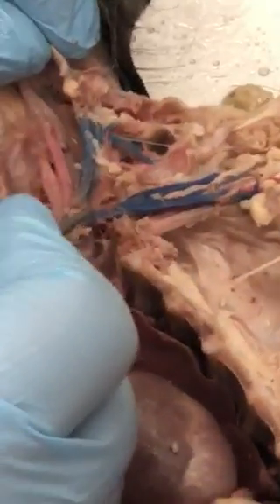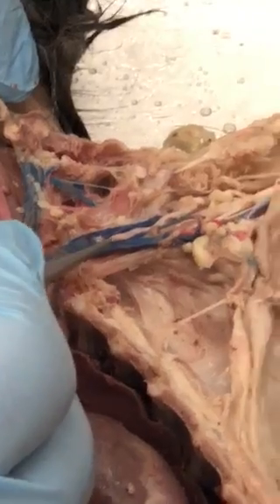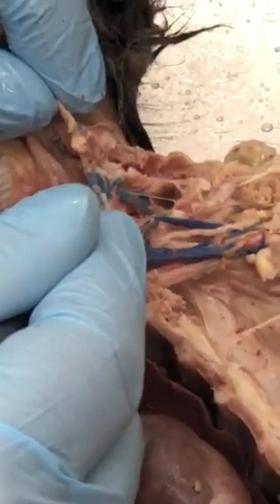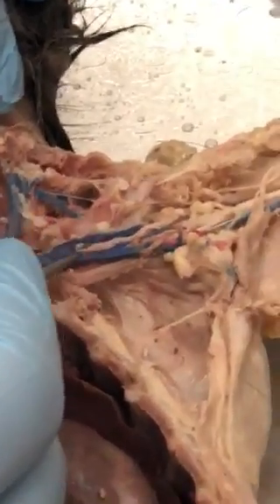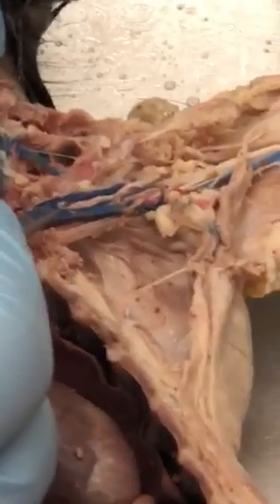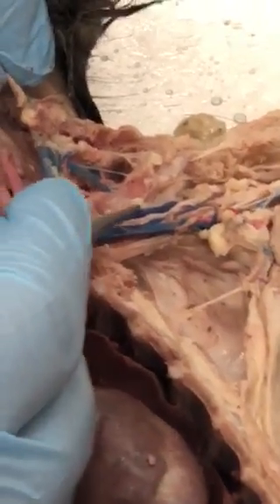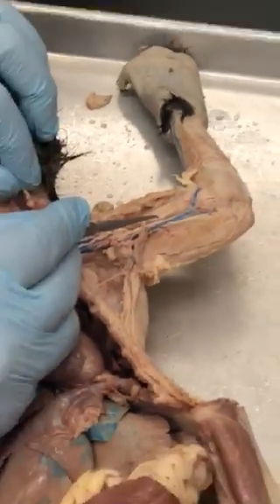This is subclavian right here, and subclavian is going to go into axillary here and subscapular. So that one's a subscapular, this is axillary, and this is subclavian only there. Subscapular, axillary, and if I put the pin out here in the arm, that's brachial.